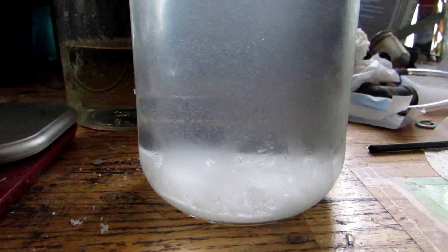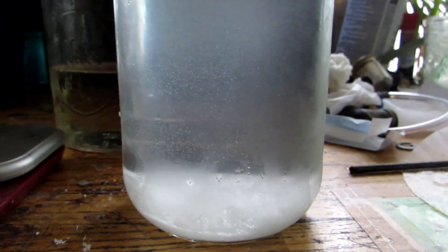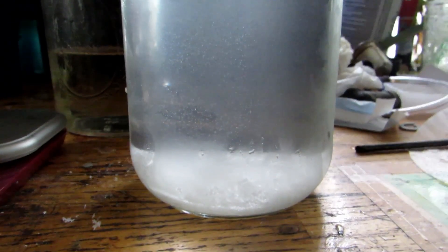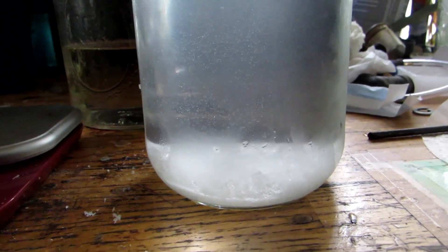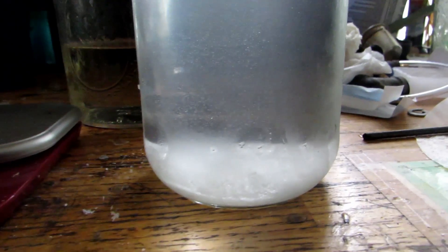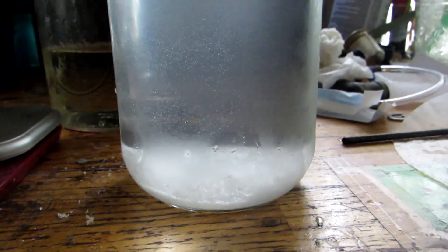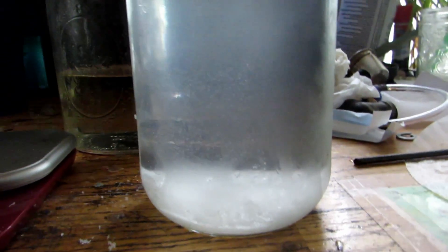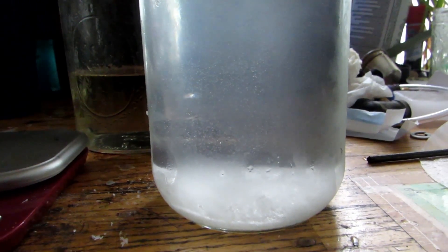I made a mistake: I added 700 milliliters of water when we only needed 70. I got the solubility wrong — it's actually 240 grams dissolving in 100 milliliters of boiling water, far more soluble than I initially thought. That means I now have to boil the whole solution back down to re-obtain the potassium nitrate crystals, which will take extra time.